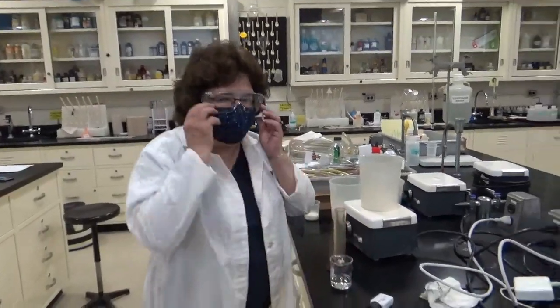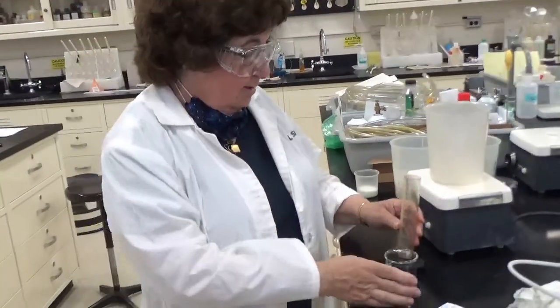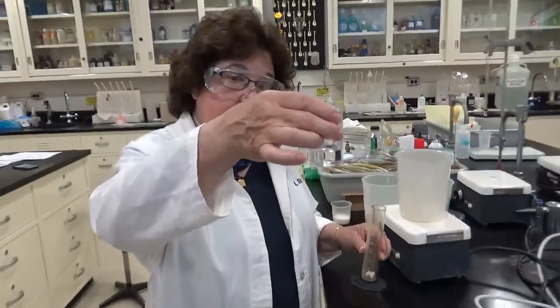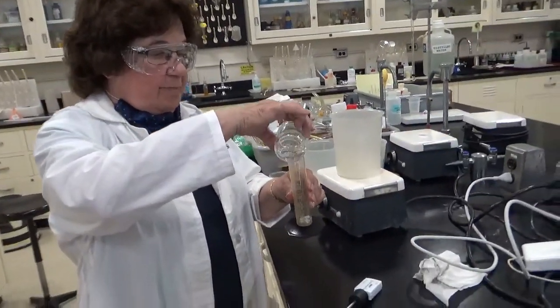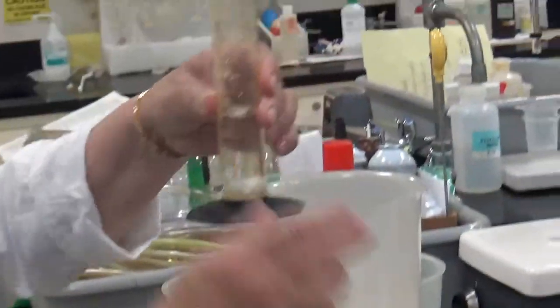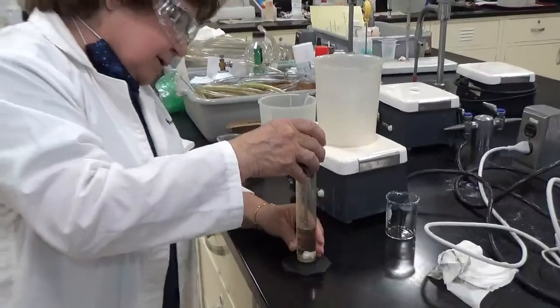So now we're going to do the experiment over again, but we're going to use the urea that Professor Cooley just measured out. So we have a really nice solution of urea. We've measured everything about it, so we know how much it weighs and we know how much urea is in here. So I'm going to repeat this experiment. Okay, and now we're going to put our probe in this mixture.